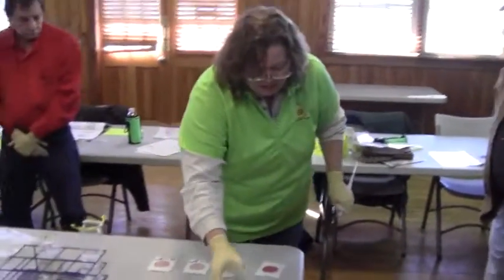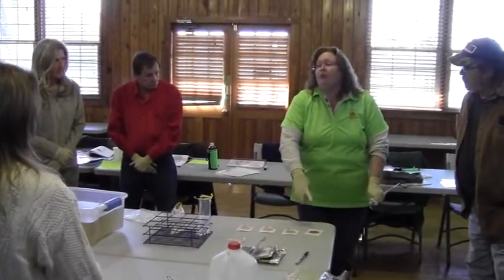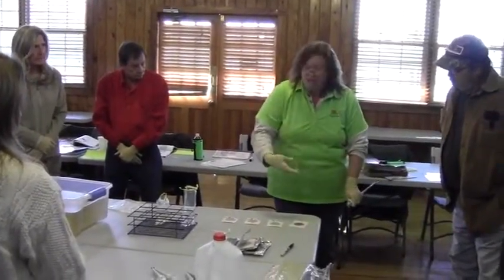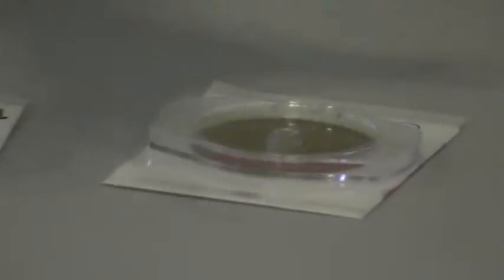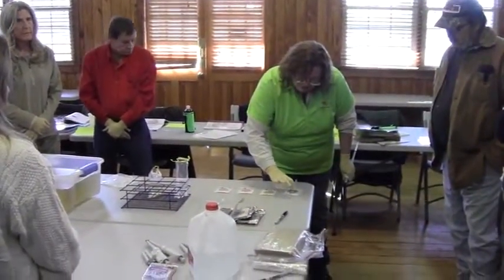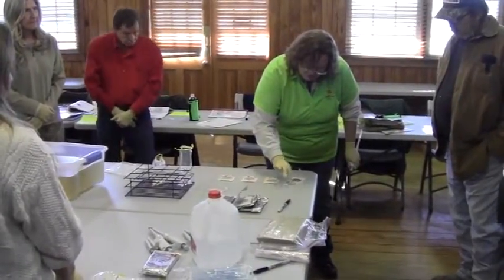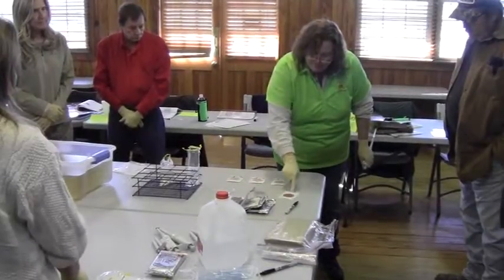This is to help push this down. You don't want to put it on there and rub it around, because then you use up all of the food on the plate for the bacteria. So all you do is just take it and set it on there, and the weight will push it out. We're all done — very gently squish it off. Take our little control plate and put it up.